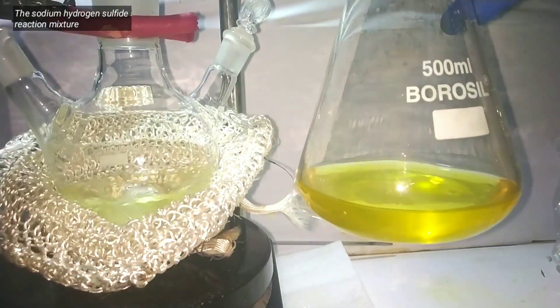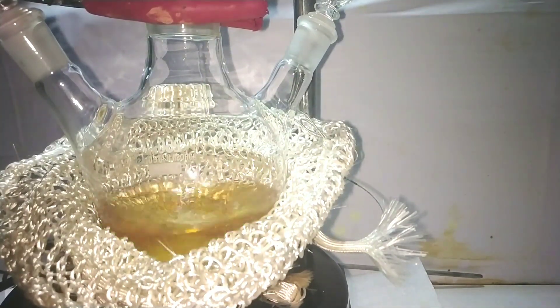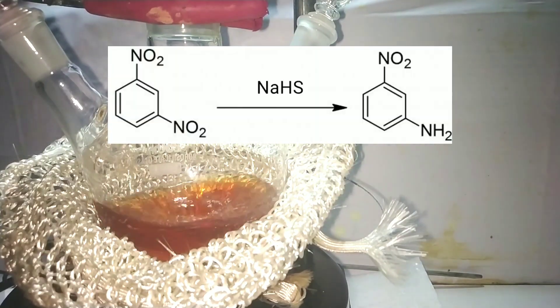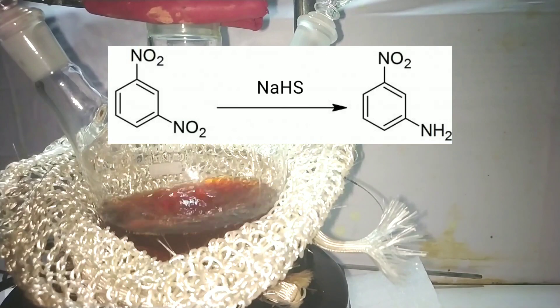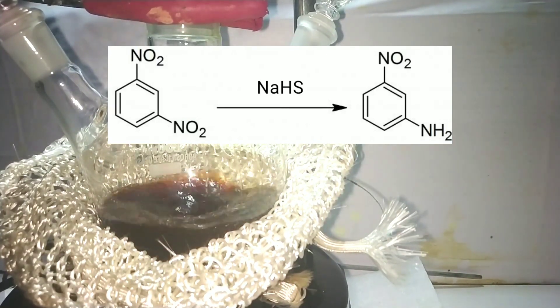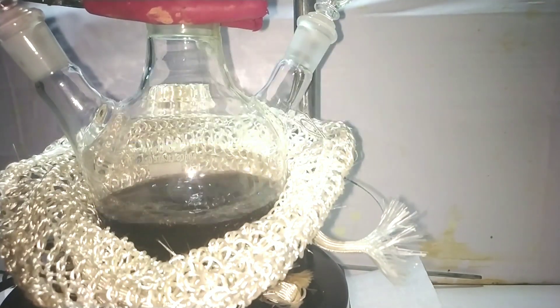Now we add the previously prepared methanolic solution of sodium hydrogen sulphide to it. Immediately upon addition, we observe a colour change. What is happening here is the selective reduction of 1,3-dinitrobenzene at the third position, forming 3-nitroaniline.